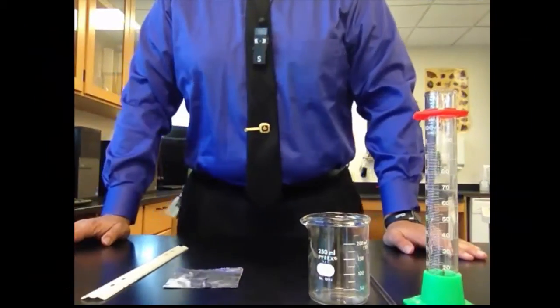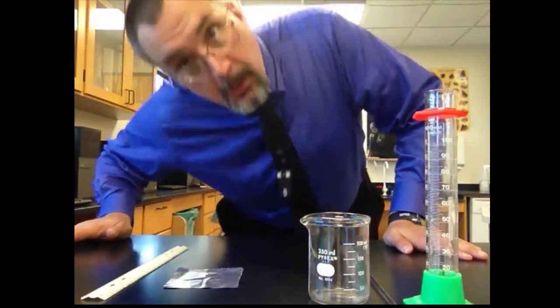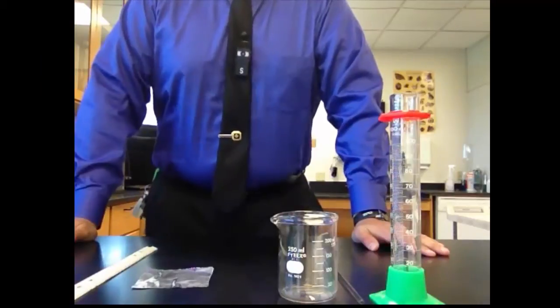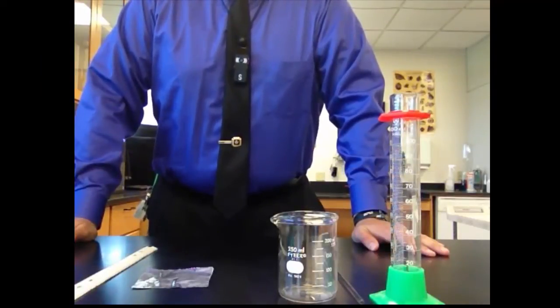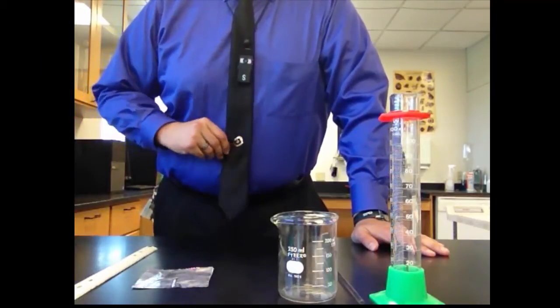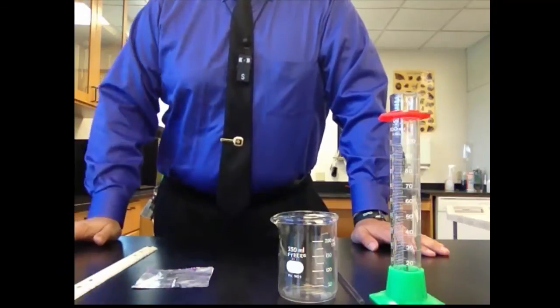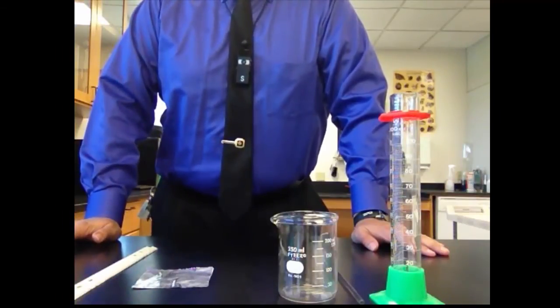We've talked a little bit about observations and inferences. Remember, you're making observations in this lab. And we're going to start by taking a look at the equipment that we're going to be using. I apologize that my head is out of frame. I'm really up here. But I wanted you to see the equipment that we're going to be using.